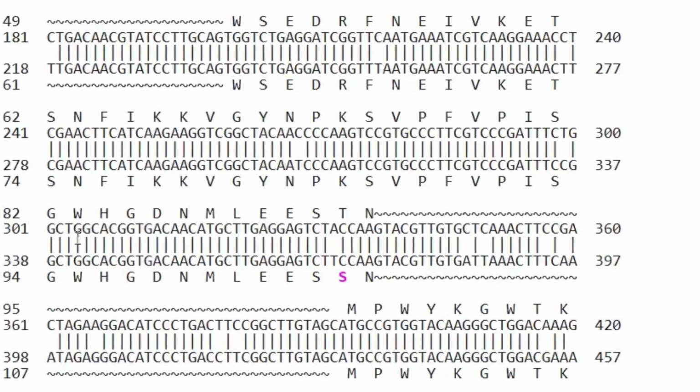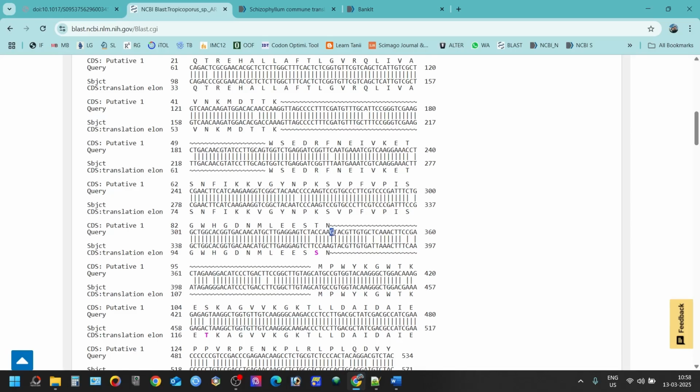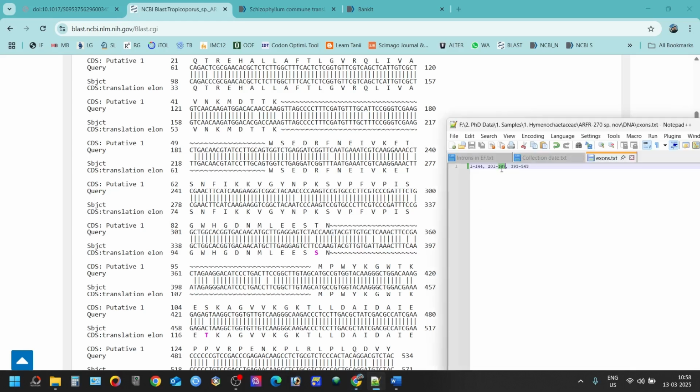If you go from here, it will take longer, so you can come from the opposite side. So 360, this one is 360. You can say 359, 58, 57, 56, 55, 54, 53, 52, 51, 50, 49, 48, 47, 46, 45, 44, 43, 42, 41, 40, 39, 38, 37. So from here, the non-coding region starts. So up to this 337, we have our coding region.